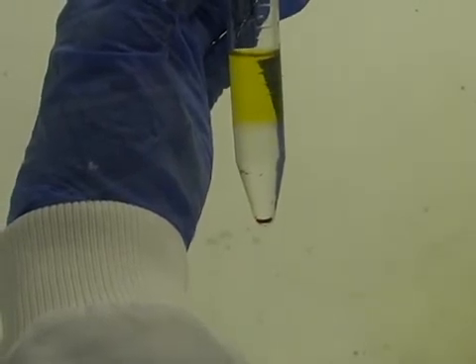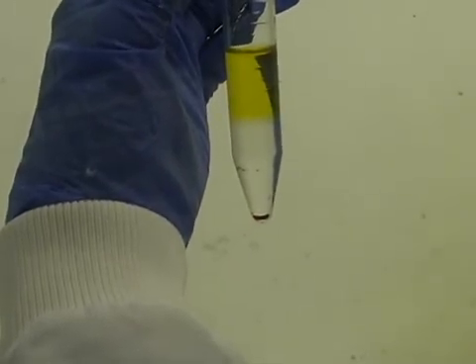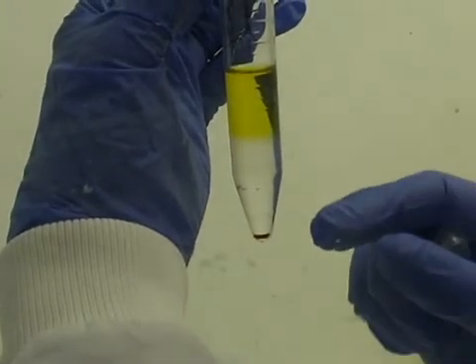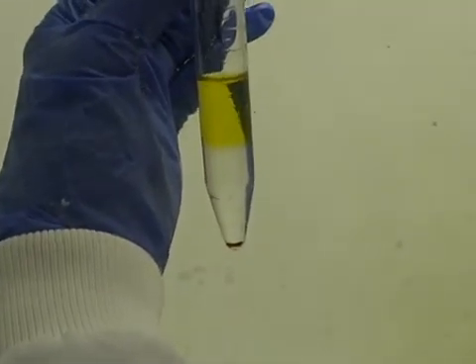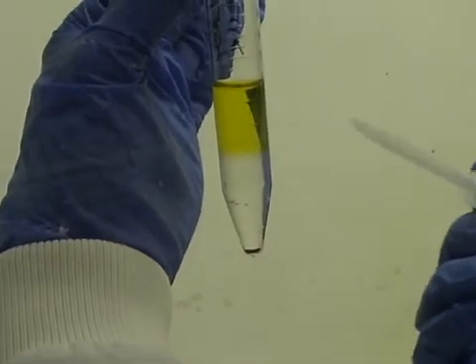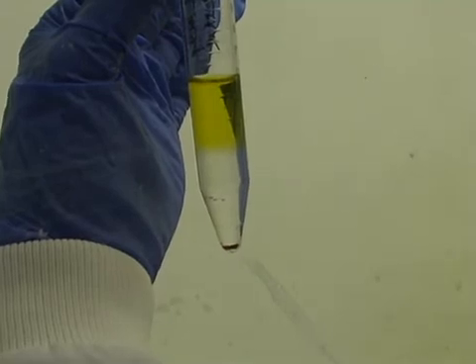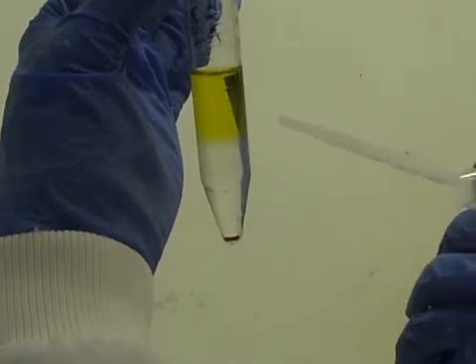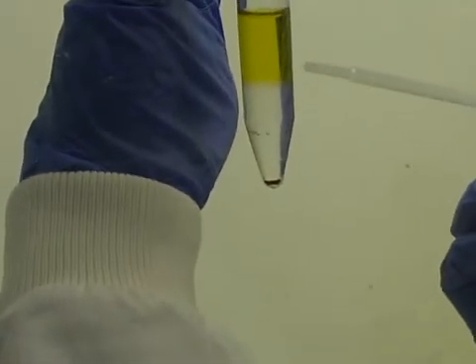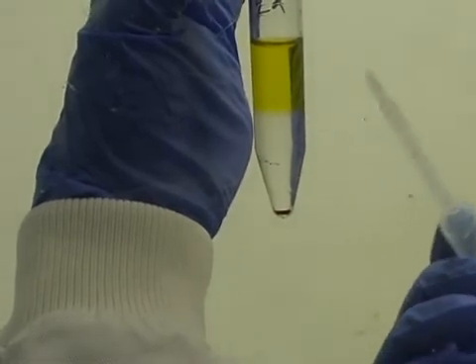We put a special fluid into the conical with the bloody fluid and we spin it for half an hour, and it gives us this result where it splits the sample into layers. As you can see, all the blood comes to the bottom of the conical and there's a buffy layer just underneath the yellow layer, which is all the cells.